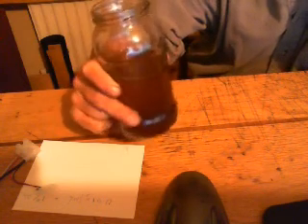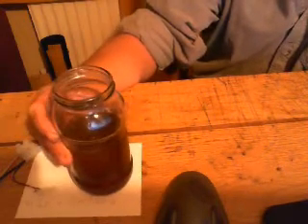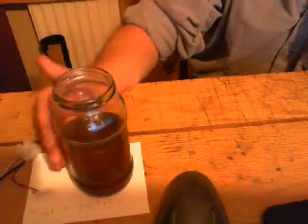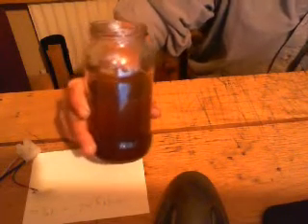Now, once you've got graphene oxide, you're pretty much there. You can paint this stuff onto glossy paper or plastic, let it dry, paint it, let it dry — and then once you've got your thin film of graphene oxide, you can turn it into graphene. There are two ways a homemaker can do it: one is putting it in a LightScribe DVD burner, and another is flashing it with a photo flash — both apparently work. What I need to do is evaporate it down so it gets more concentrated, but before that I want to sonicate it, then evaporate it to a deep brown colour so we can paint it onto things and either laser scribe it or photo flash it to turn it into actual graphene. My next job is to build a sonicator — but where I am right now is graphene oxide in solution.